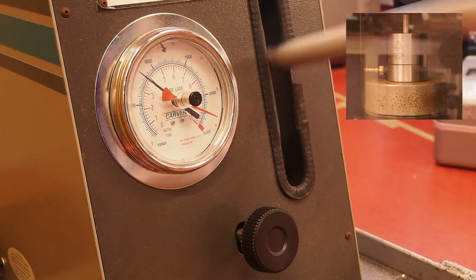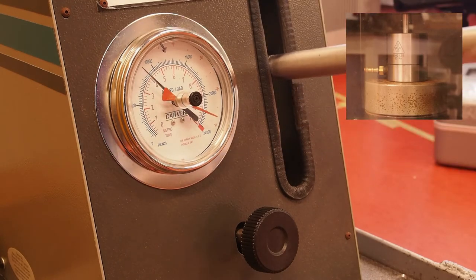For your convenience, the correct pressure level has been indicated by a black line on the press.